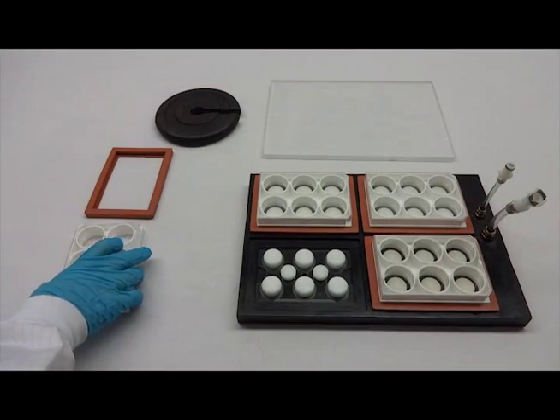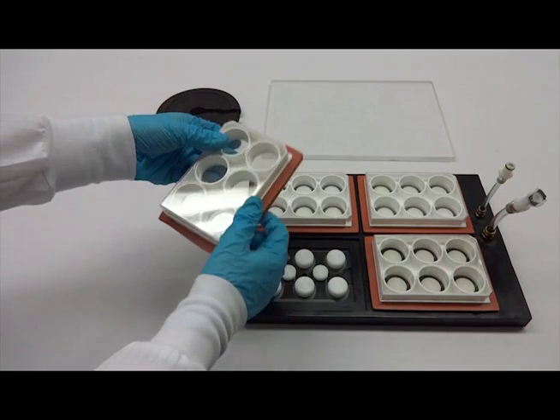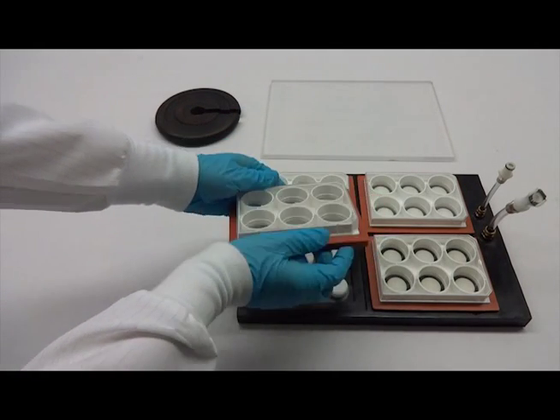Then, take your six well culture plate and fit the gasket around the bottom edge of the culture plate. Place the culture plate and gasket directly atop a loading station.